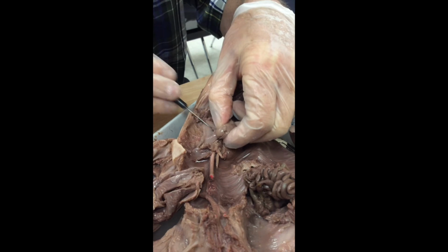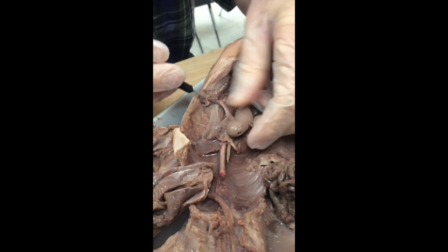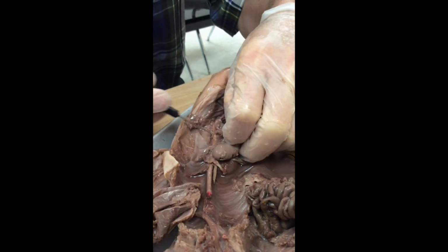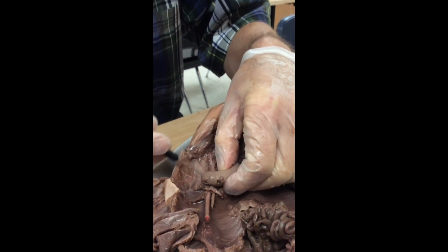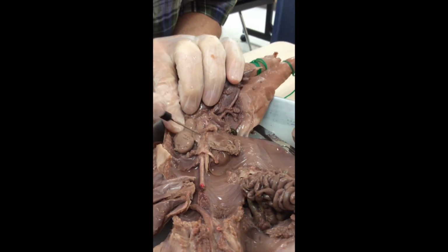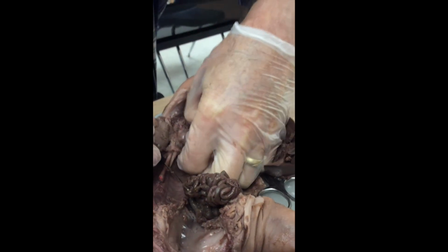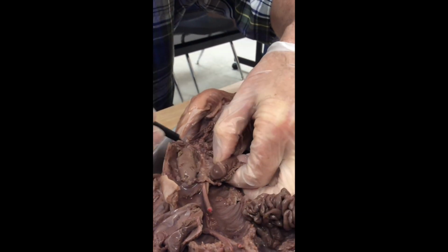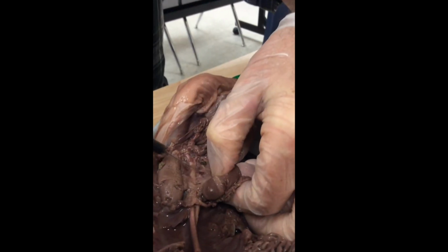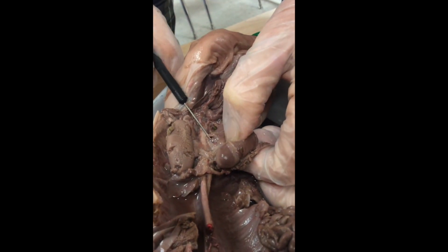There are three pipes that enter and exit the kidneys. We've got what's called a renal artery. We have a renal vein, and then we have a pipe that carries the urine down to the bladder. And that's called the ureter, and I think I severed it on that side. Let me see if I can preserve it on the other side. I'm teasing through the tissue. Do a little more careful work on this side maybe, so we can see the vessels. There we go. There's the renal artery right there.